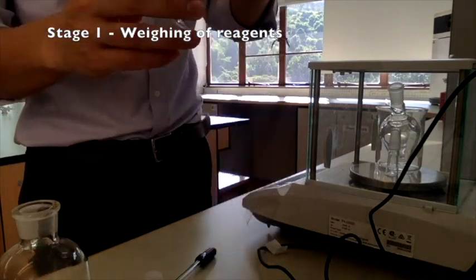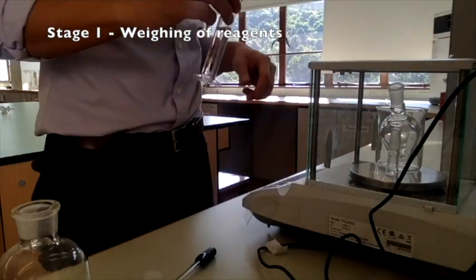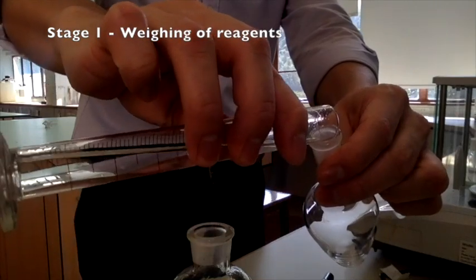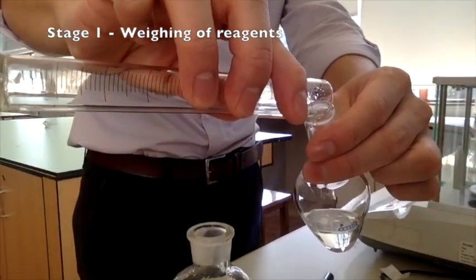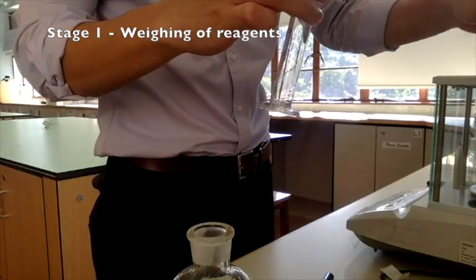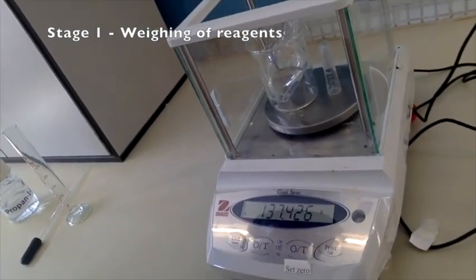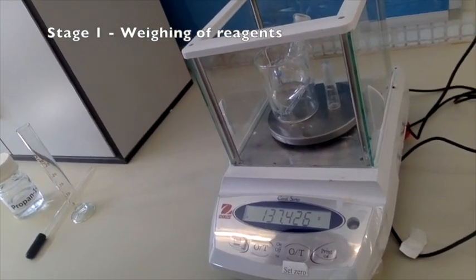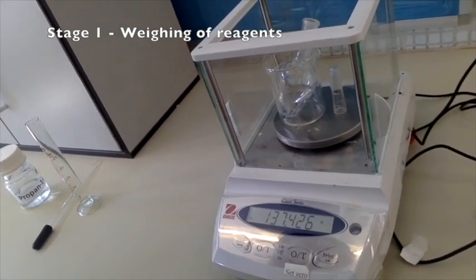So my suggestion is you first measure around 15 cm cube and you can pour it down. So we can pour it in around 15 cm cube. Well, that's a little bit too much, but again, you do not have to be very accurate. You just get approximate amount, and most importantly, you know the actual amount. Okay?